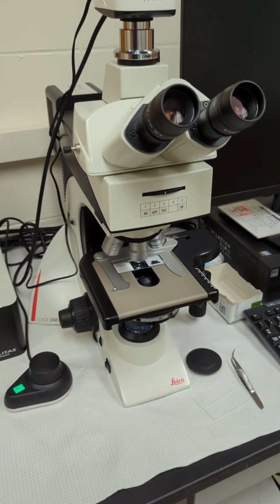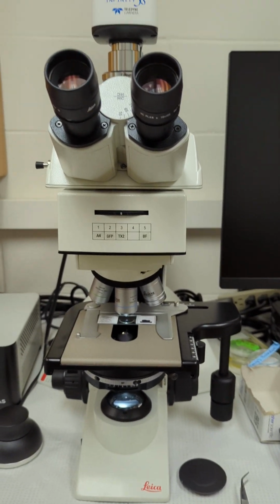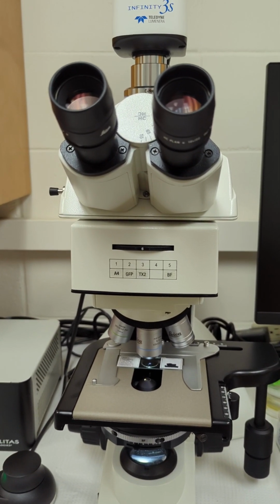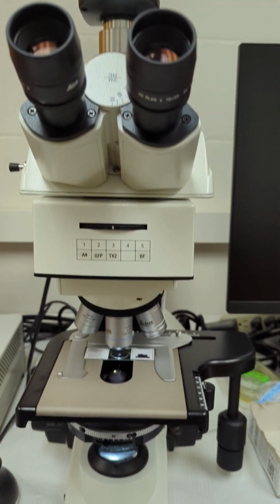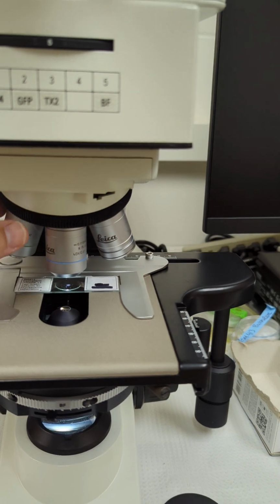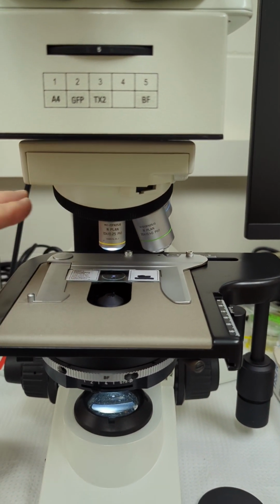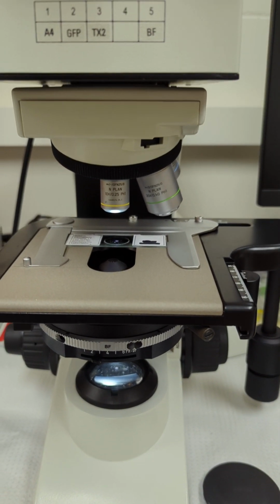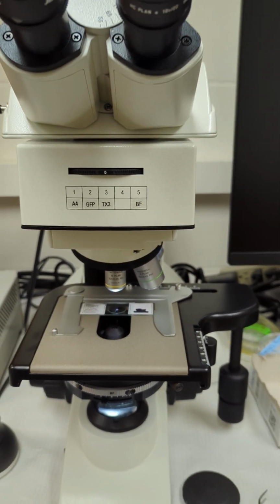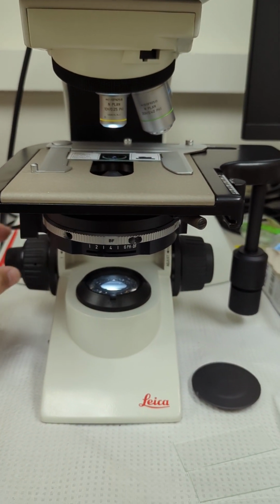All right, so using the microscope in Brightfield mode. After you've done all your adjustments on the eyepieces and had everything corrected for your eyes, then you come down here and select which objective you're starting on. Let's say we'll start on the 10x. And obviously look into the microscope and focus, using the focus knobs.